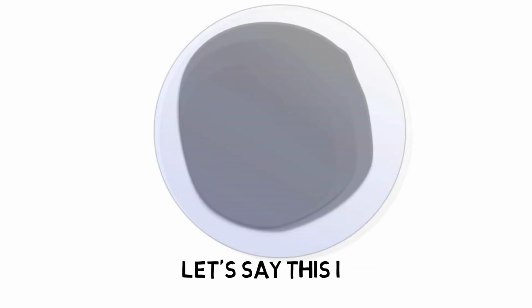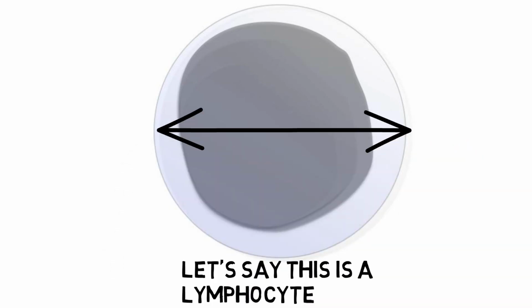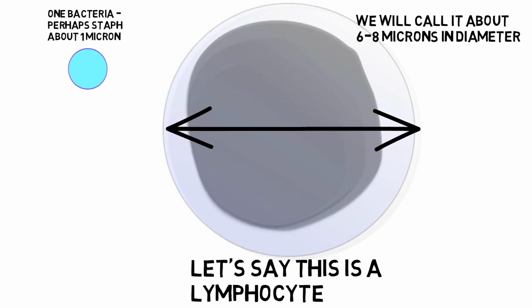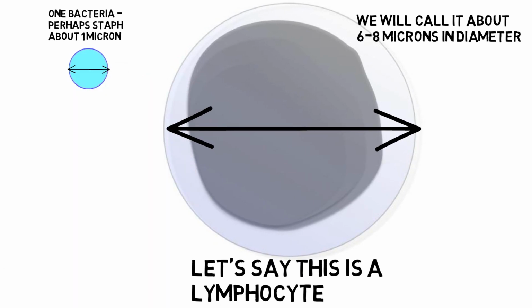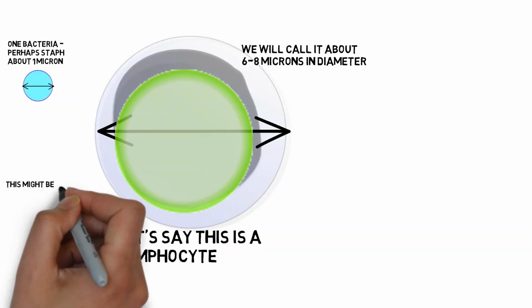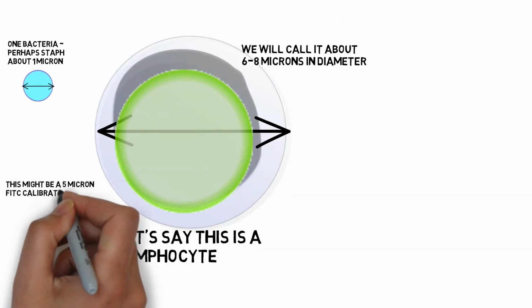Imagine this is a lymphocyte. It's going to be about 6 to 8 microns in diameter. Beside it, we have a 1 micron object. Perhaps it's a bead or a bacteria like Staph aureus. Now let's see what a 5 micron bead might look like compared with a lymphocyte.